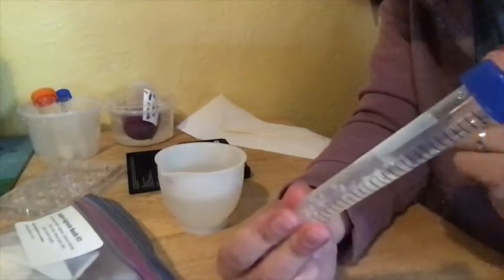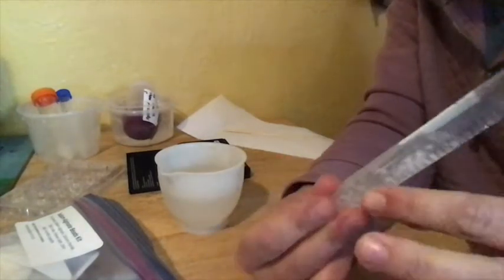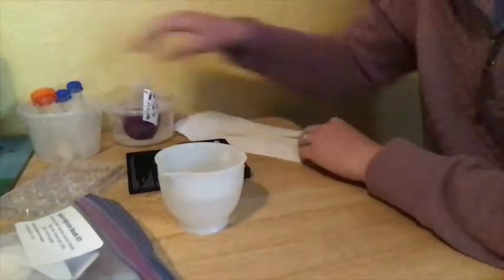All right, and you can see mine is still actually kind of lumpy here. You want to use a wooden stir stick, or chopstick, or something to really smash up those lumps, to make sure that it's really smooth. Set that aside.